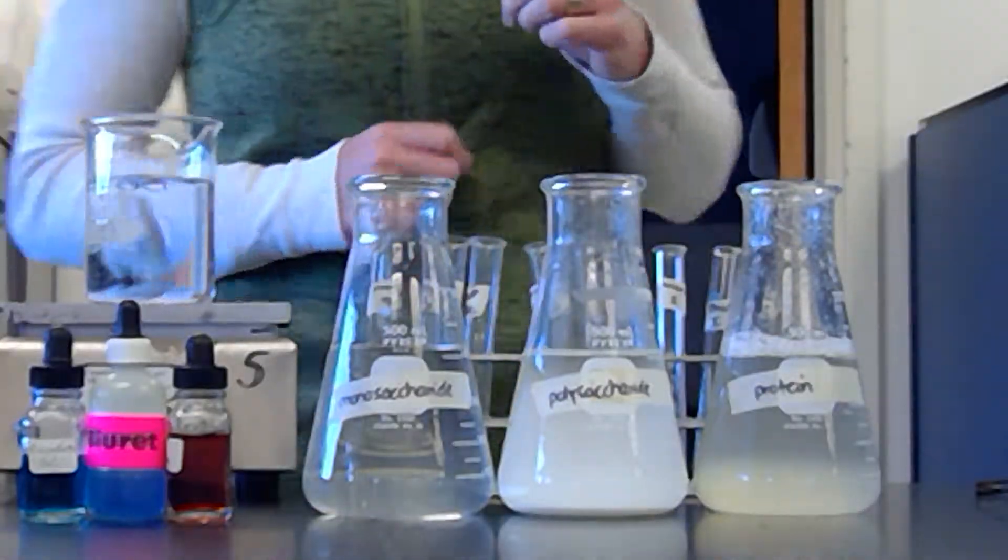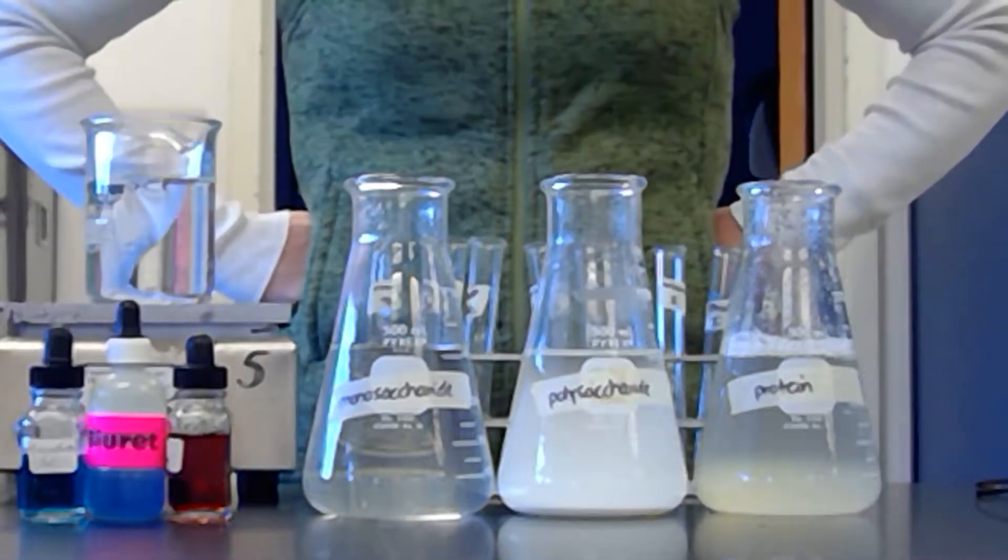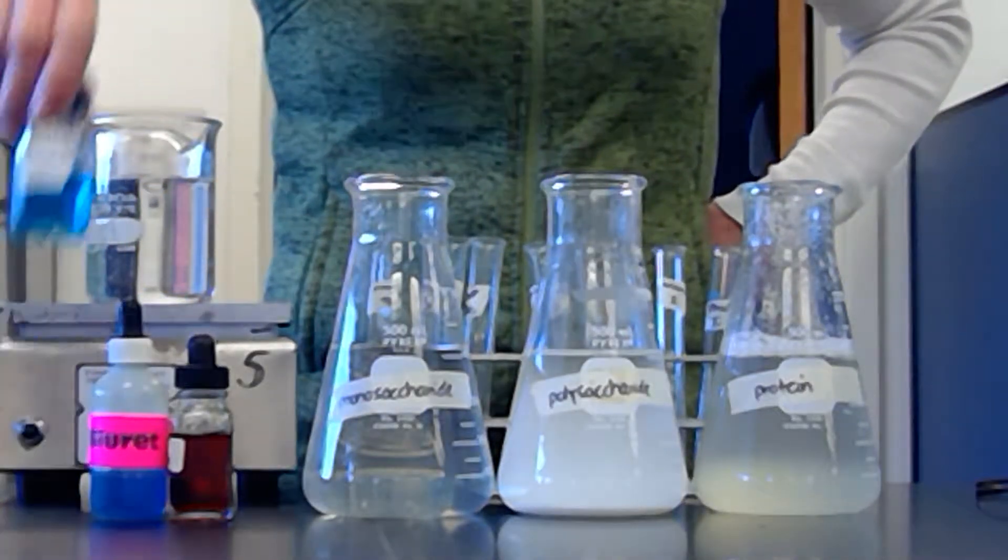All right, so this lab is a macromolecule indicator lab. I'll explain the supplies and then I'll go through the lab like if you had done it. So we have indicators, and we have three. This one is Benedict's.